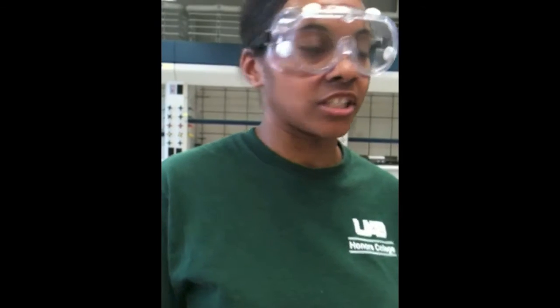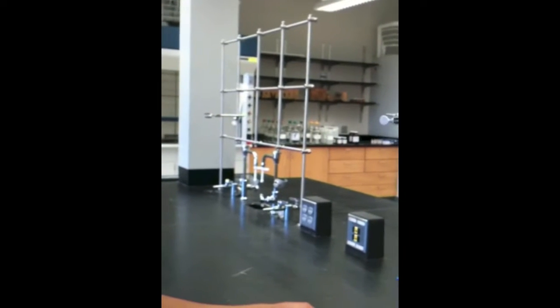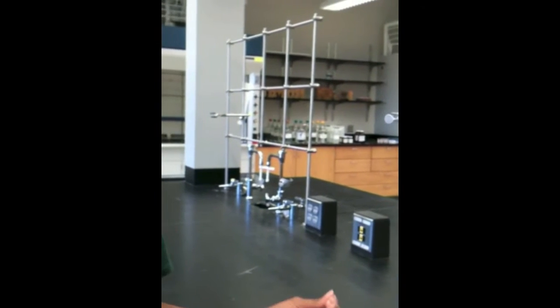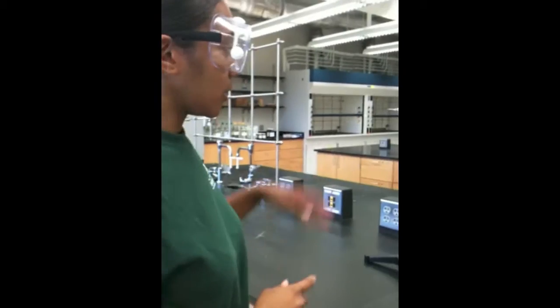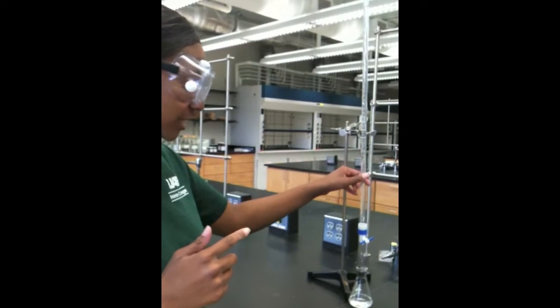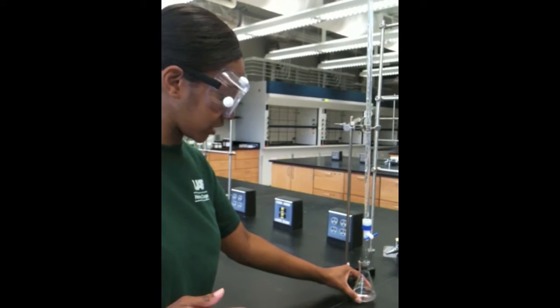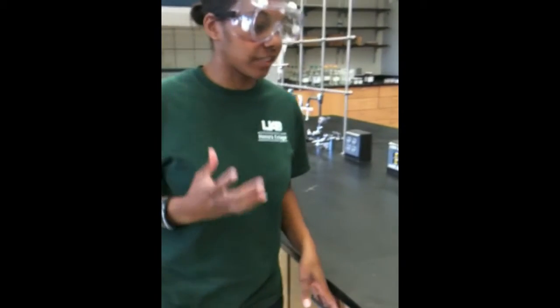But in this case, we're going to determine the unknown concentration of a solution of NaOH, which is going to be the analyte. And we have potassium hydrogen phthalate, which is going to be the titrant, which is a known concentration. So in order to do a titration, you have to know the concentration of at least one. So here, like I said earlier, we have unknown concentration of sodium hydroxide, and we have the concentration of KHP known. So what we're looking for, we want to find the analyte molarity.